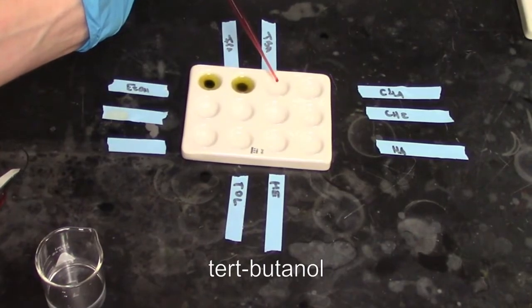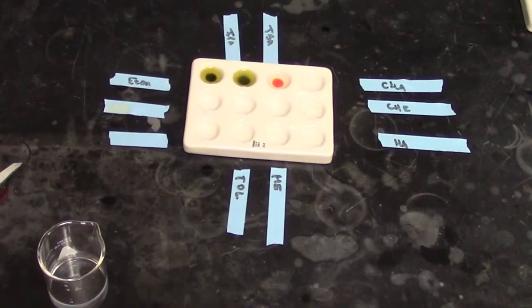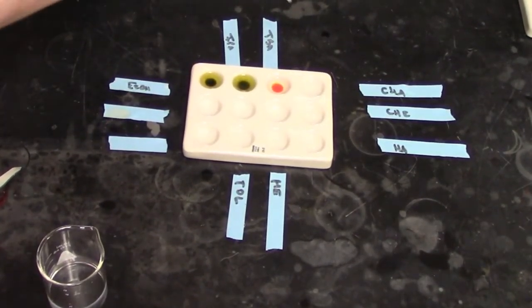Now we look at terbutanol. What we see is this stay at an orange color. So this orange color here indicates that the terbutanol did not react with the Jones Reagent.